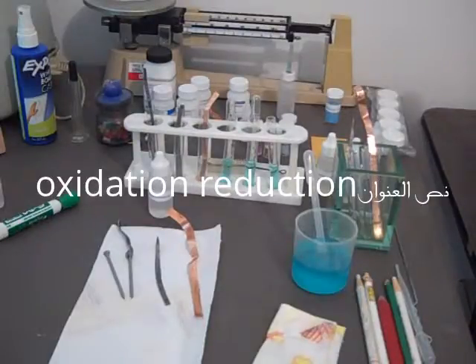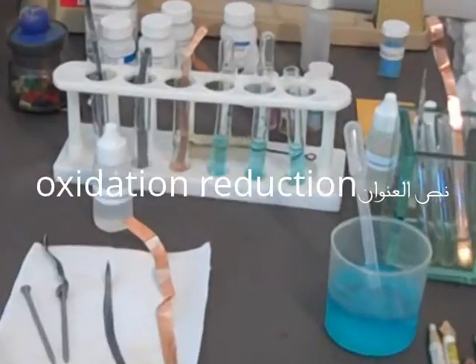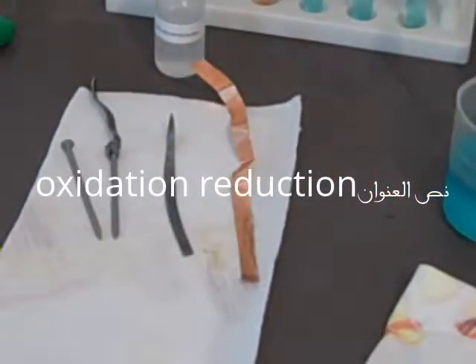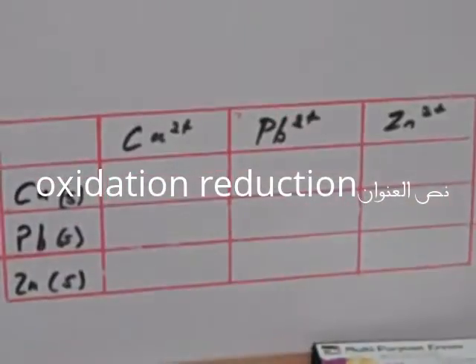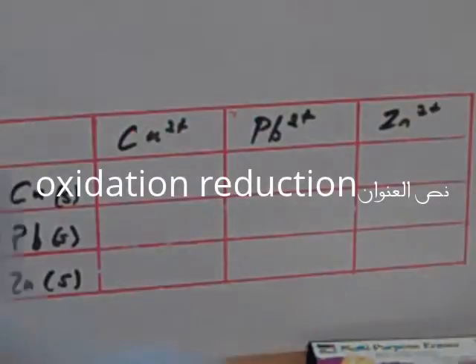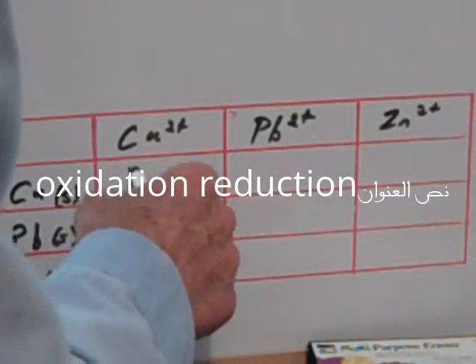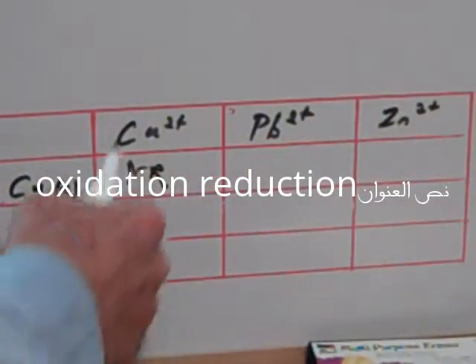So we're going to write that in. I'll give you a close-up first—how close we can get without losing focus here—so you can see those. Alright, then we're going to go over to our whiteboard and we're going to put in our observations. The copper—no change. So we'll put NR, sort of write like that, for no reaction. Like that.